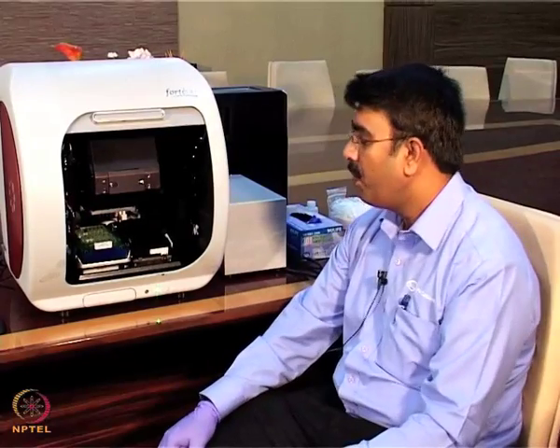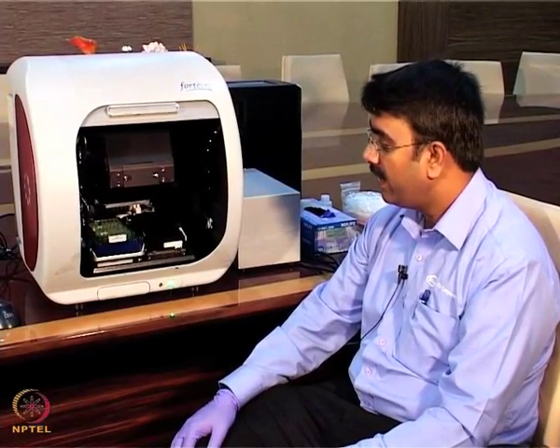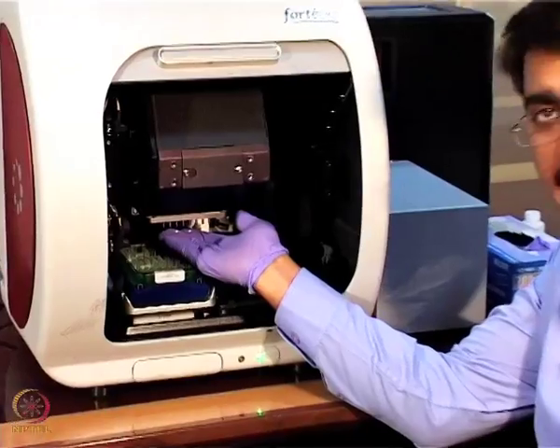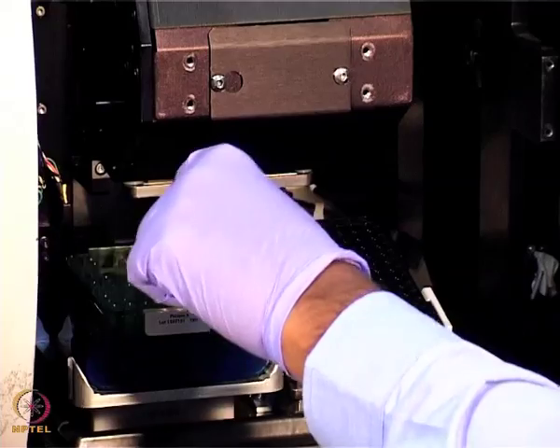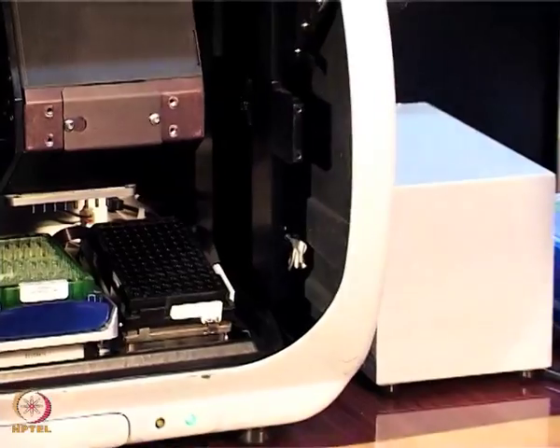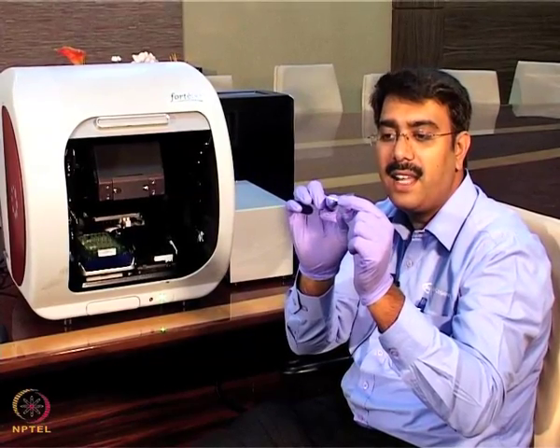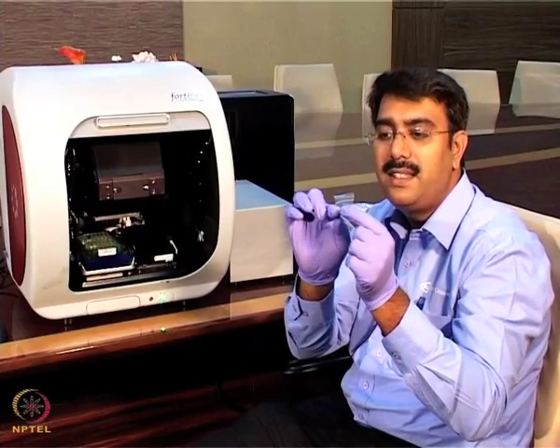interferometry. You know about the principle behind biolayer interferometry from the last talk. Here it consists of a white light, which is a light emitting diode. We pass the light from the light emitting diode through the sensor. This is the sensor. It is actually made up of glass. It consists of a fiber optic inside, and the end at the holder part is made up of plastic. So inside there is a fiber optic.